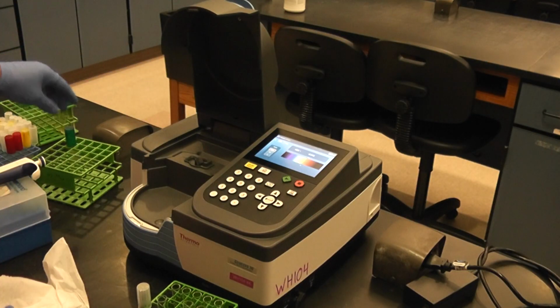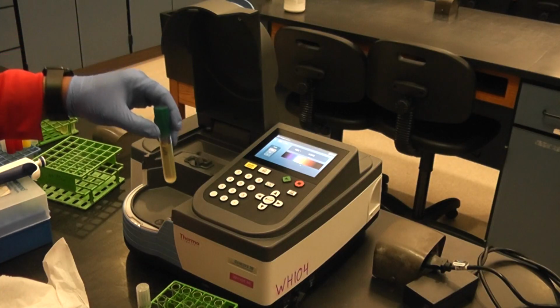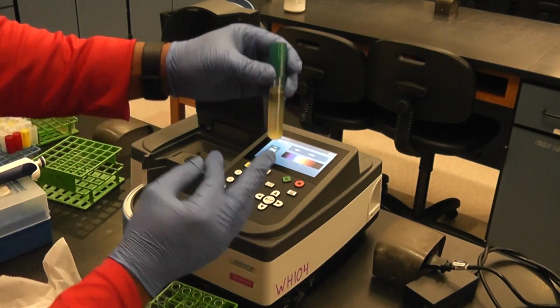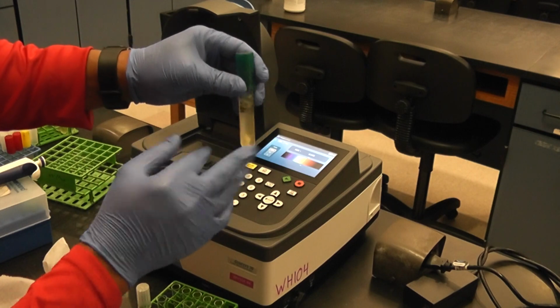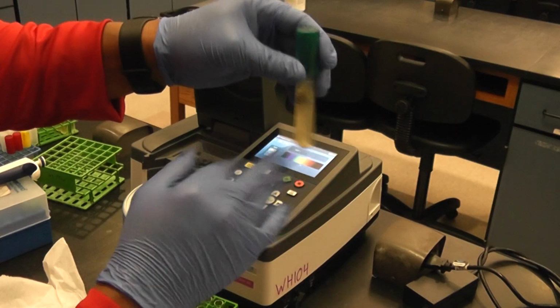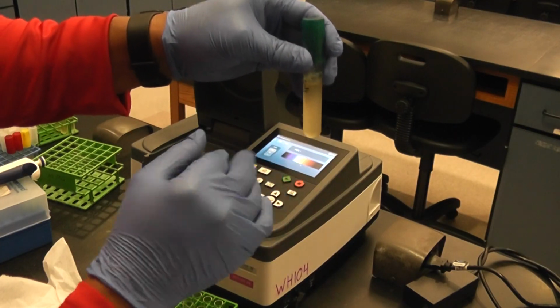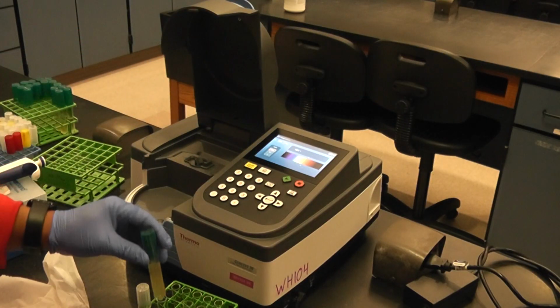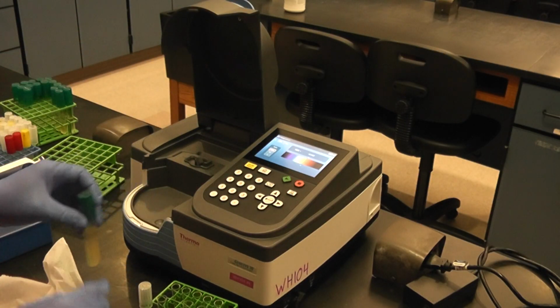Now I could just pull it out and see what my sample is. So here I have some E. coli that grew overnight, 24 hours. We want to shake it up. All the bacteria is in the bottom. You can probably see them starting to swirl around. Now they are suspended. I'm going to take some out of here and put it into the broth.